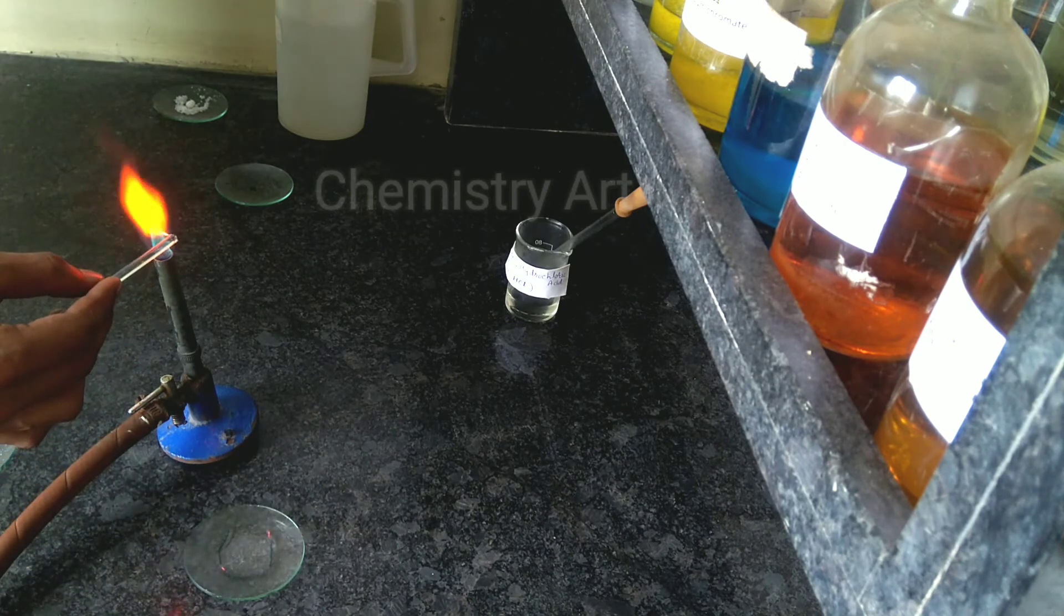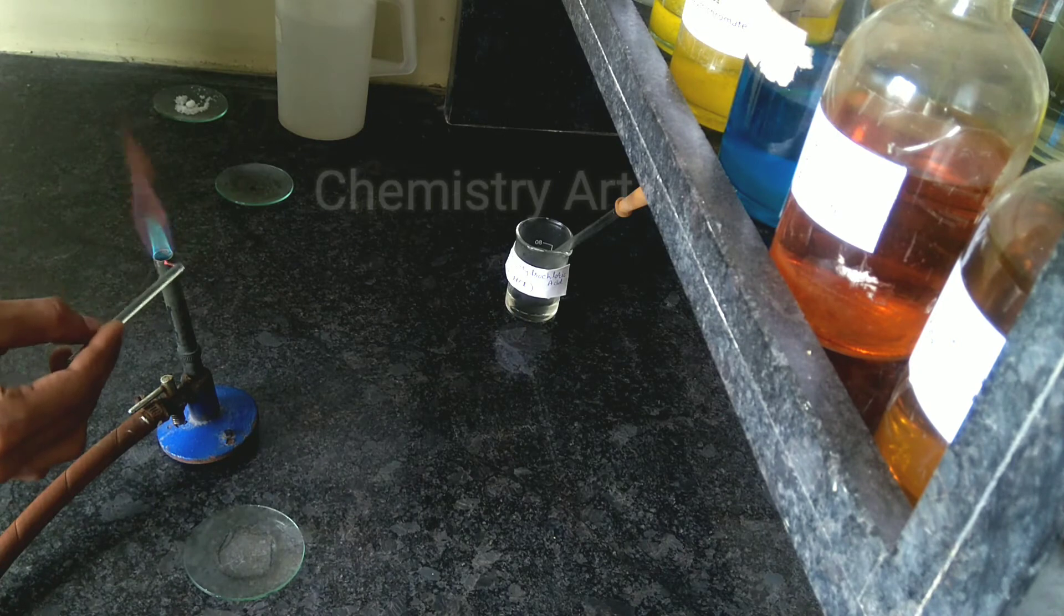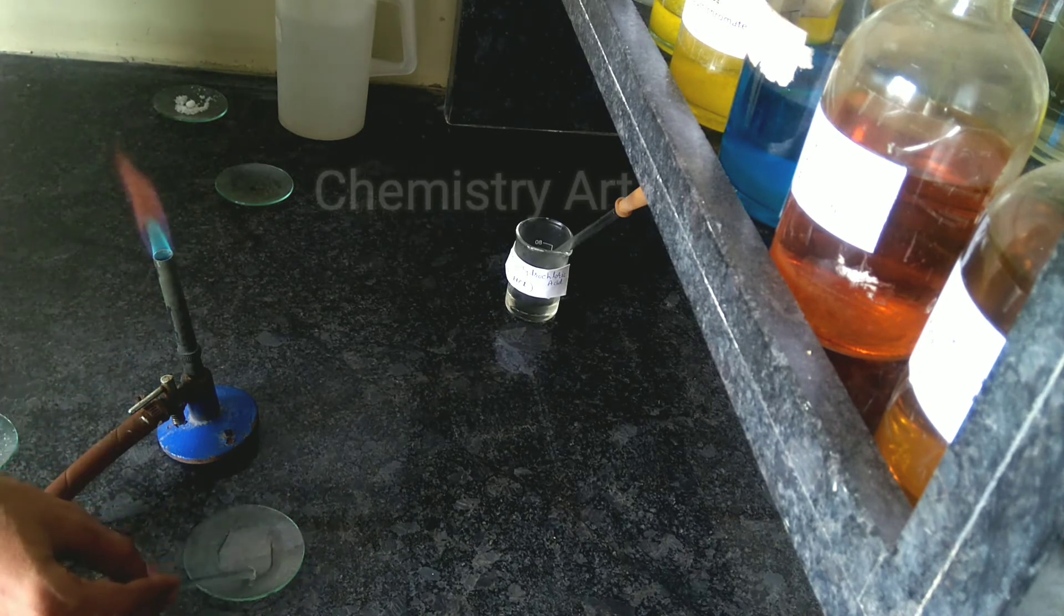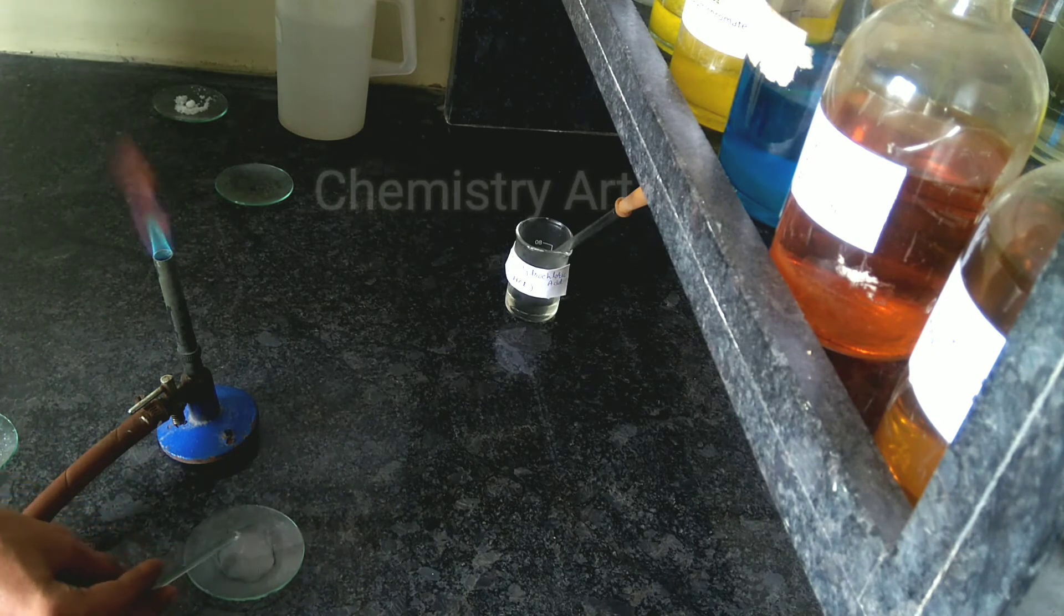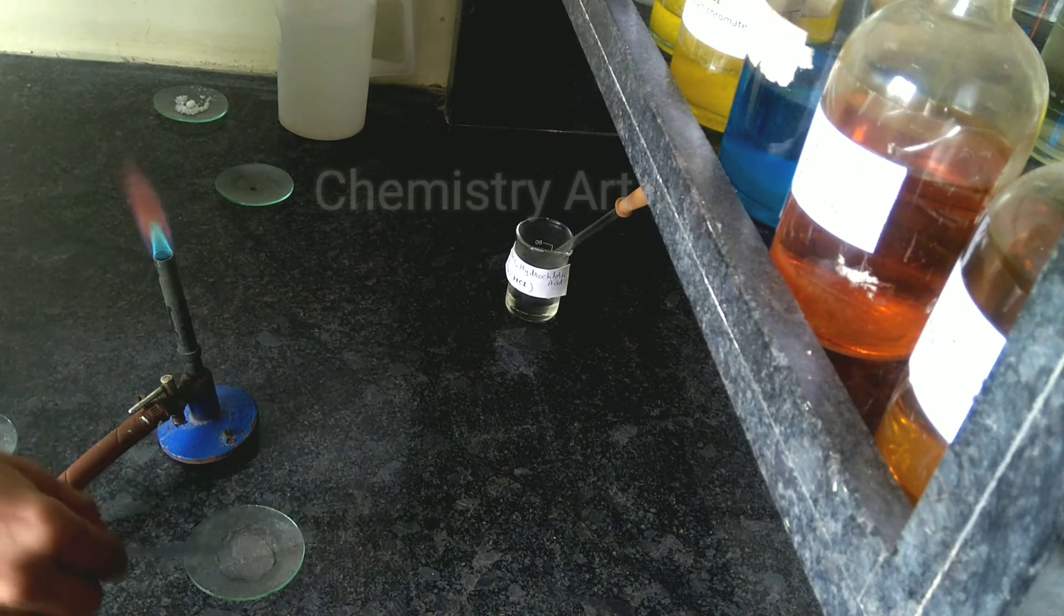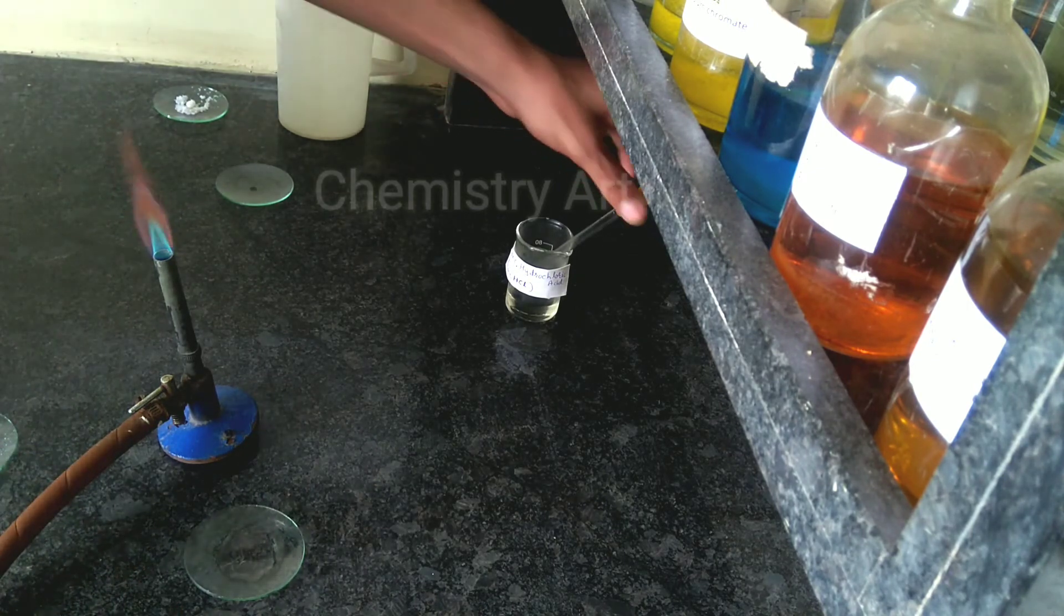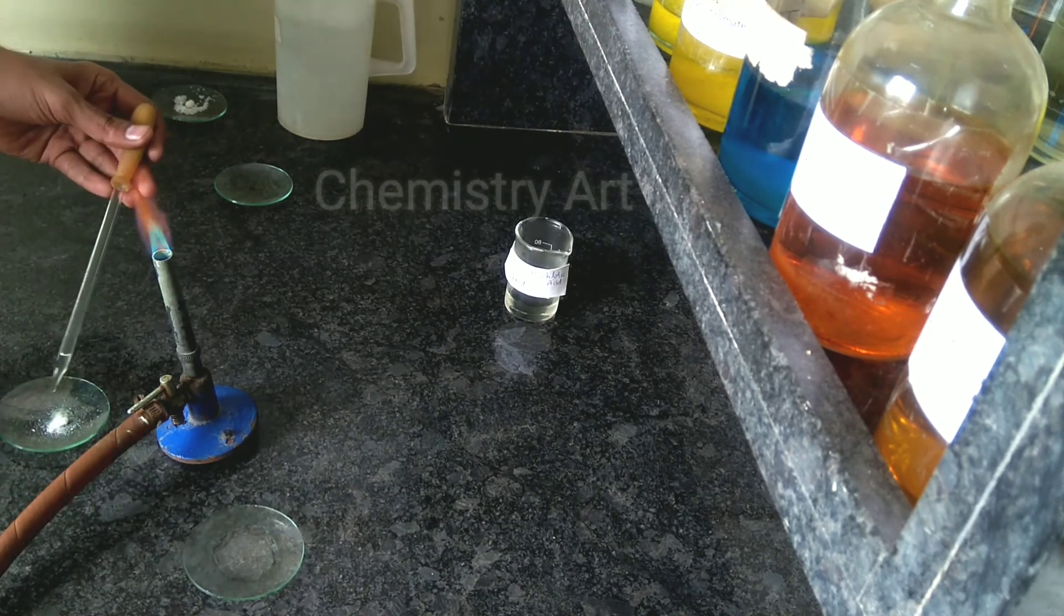Now I am cleaning the platinum wire because I am going to show you the flame test for another salt also. In this video I will show you three salts. While you are performing another salt test, you need to clean it with the help of concentrated acid.